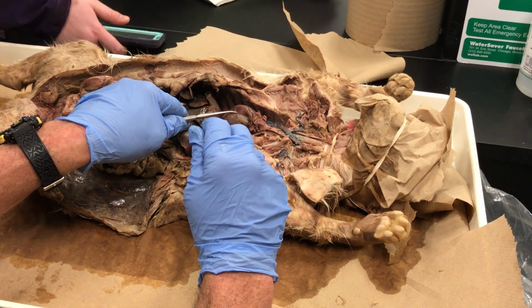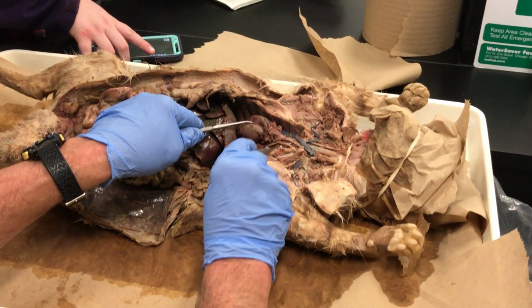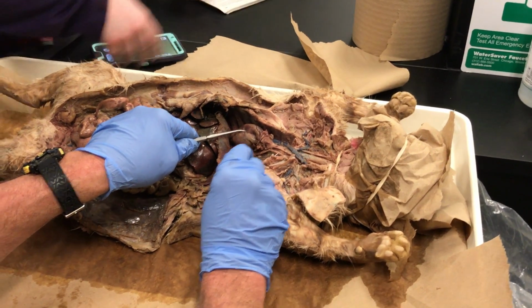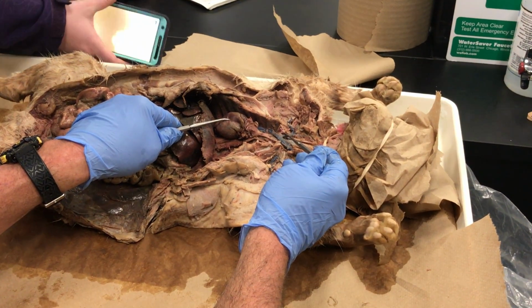So when you ask for the subclavian though, you're going to be down here? I shall put a point on it. Yeah, if I stick a pin in this vessel right there, you would say subclavian. Or if I did up there, if I stuck a pin there, that would also be subclavian. So either of those would be subclavian.